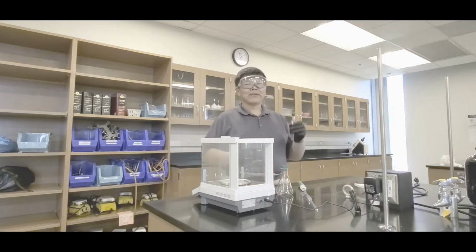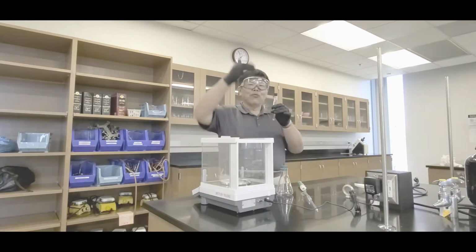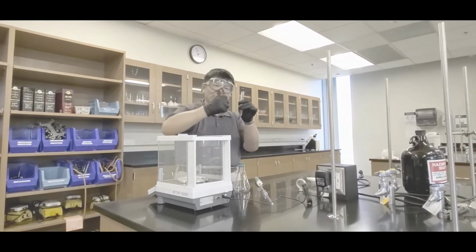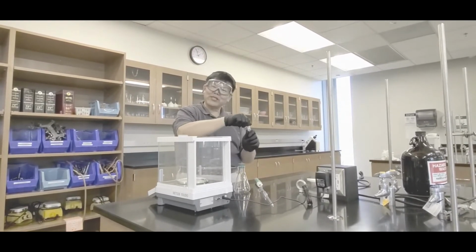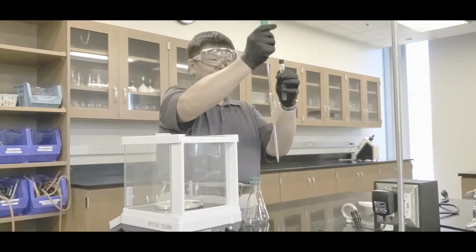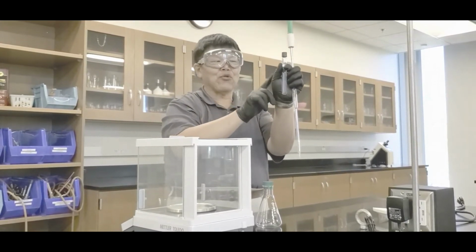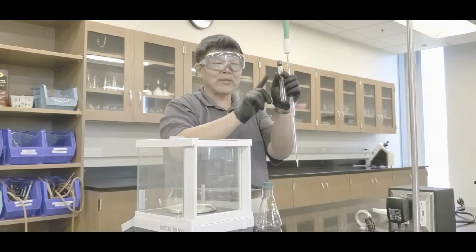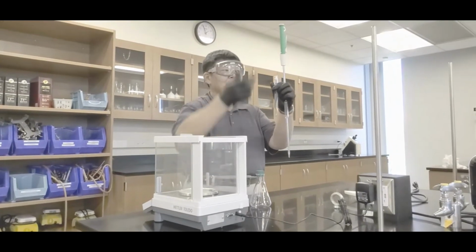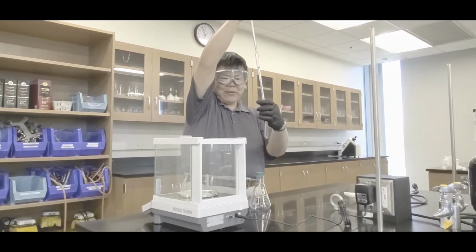Now, this technique is a little bit harder than that in the density lab, in the sense that you have to put it in, and of course, as you're drawing, you have to go down, okay? Because you don't want to just stick it in there, although it'll splash out. That's Archimedes' principle. So, make sure everything's down and prepped. Then, hey, you guys, make sure that whoever's hand is holding the test tube has a glove on. You don't want that stuff absorbed through, okay? So, here we go. Like this. Put the tip in.